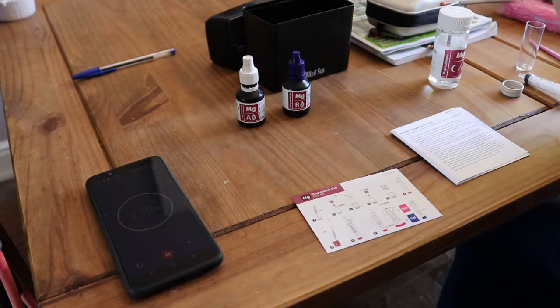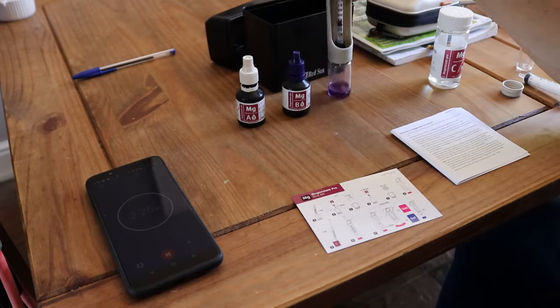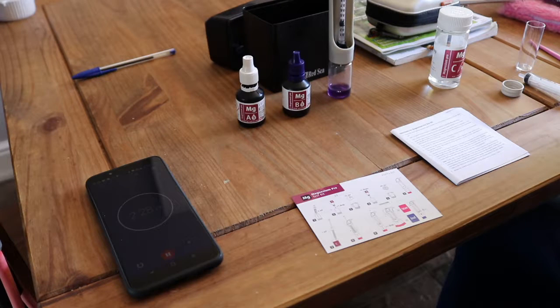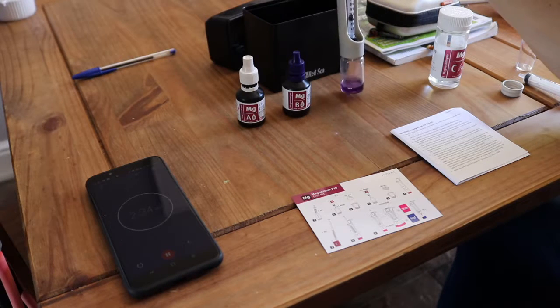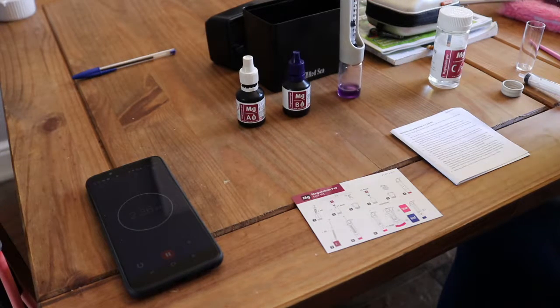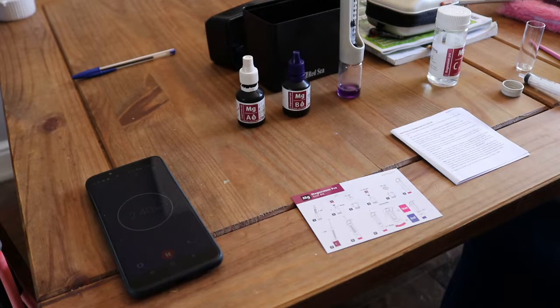So I've also got a Salifert test kit, which is obviously cheaper, a little bit less aggro than this. And yesterday I did a test, and amazingly, actually, they both came up with exactly the same result. So that was actually quite reassuring. But I'm pretty sure the way I've just done that is exactly how it should be.